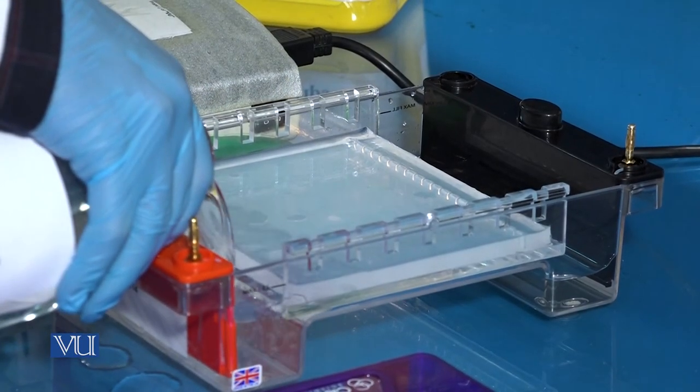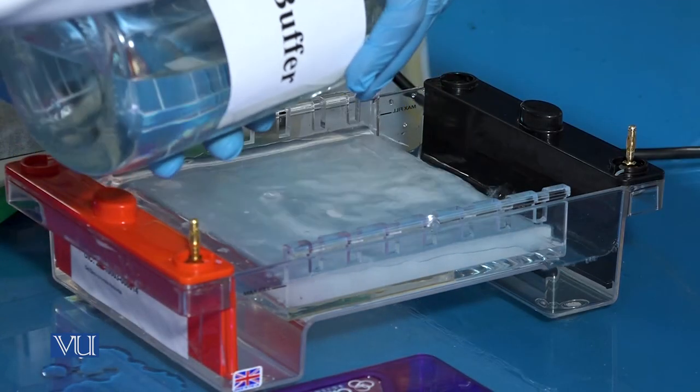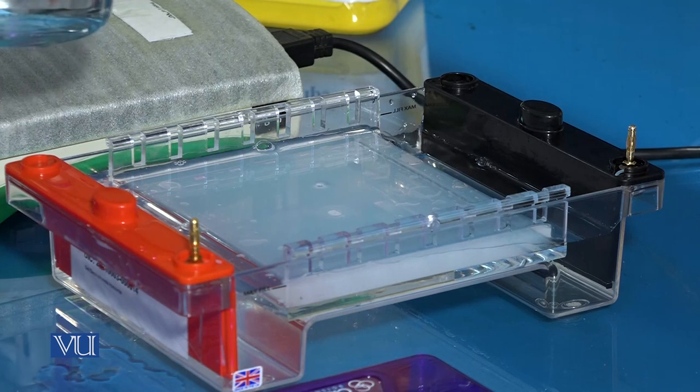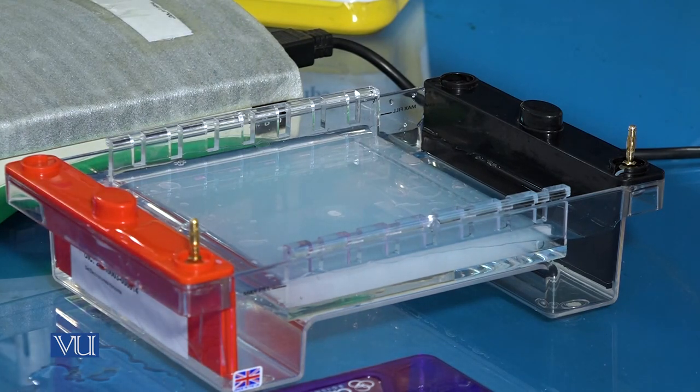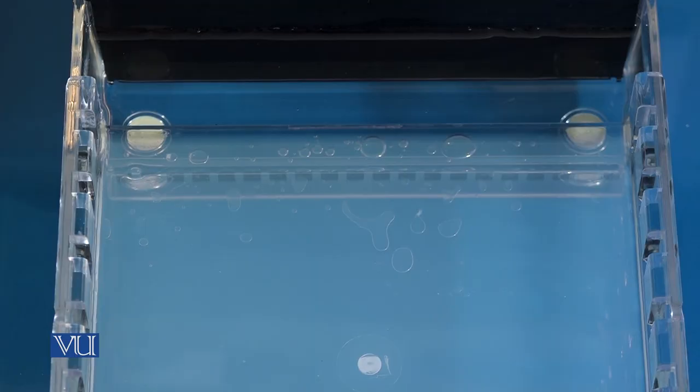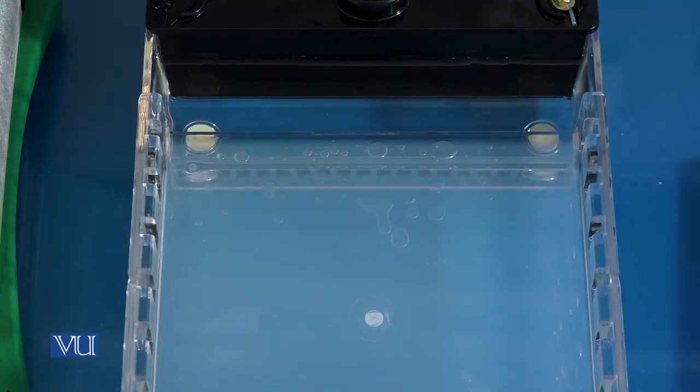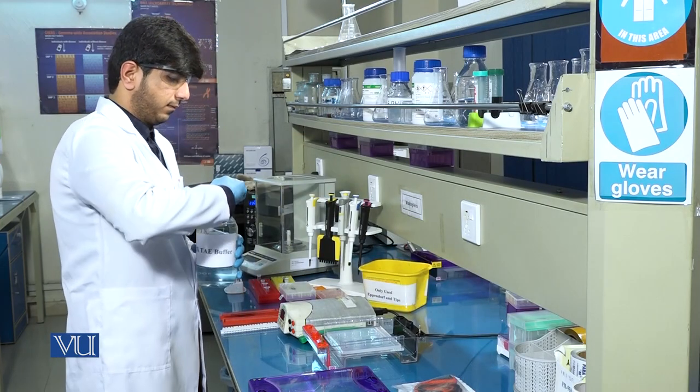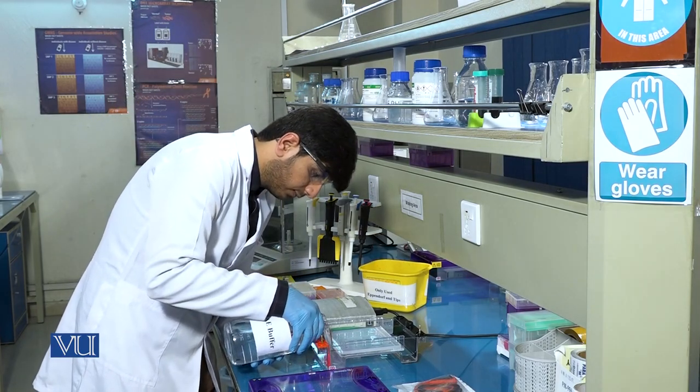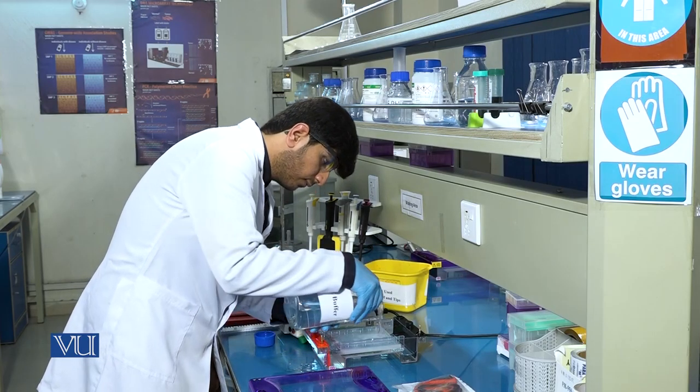It should be noted that same buffer will be added into the gel tank that was used for the gel preparation. Add the buffer to the level that gel should be completely dissolved inside the buffer.